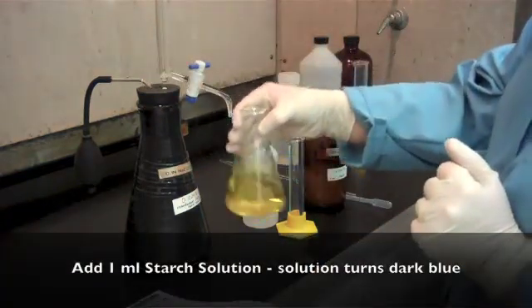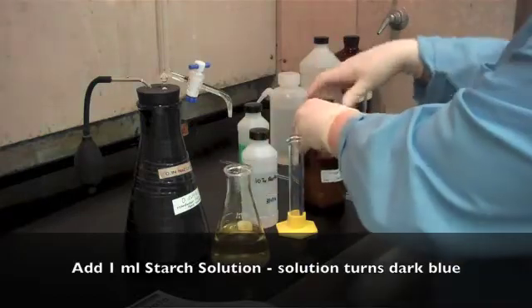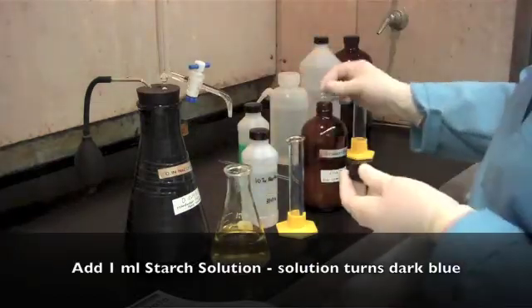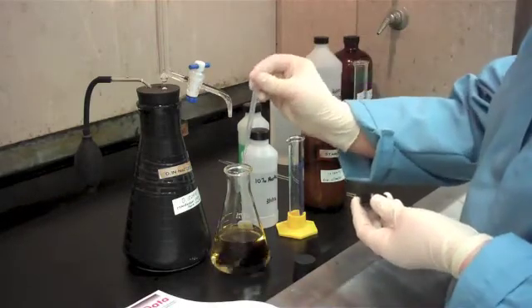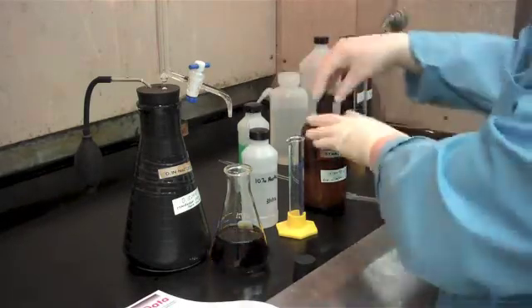Once you get the straw yellow color, I'm going to add 1 milliliter, approximately, of starch solution. And it turns a dark blue.